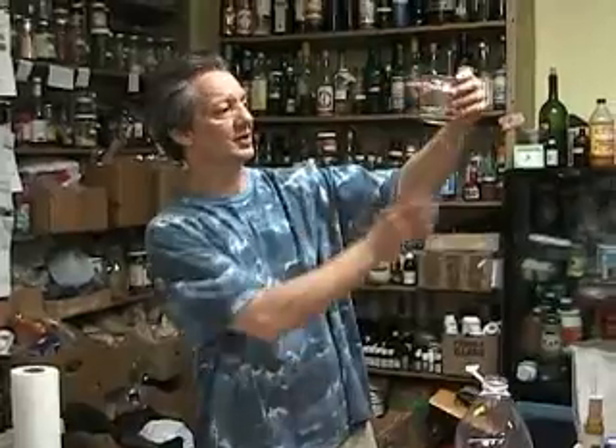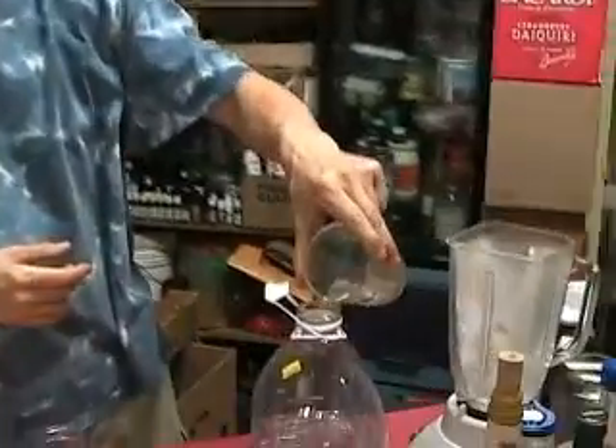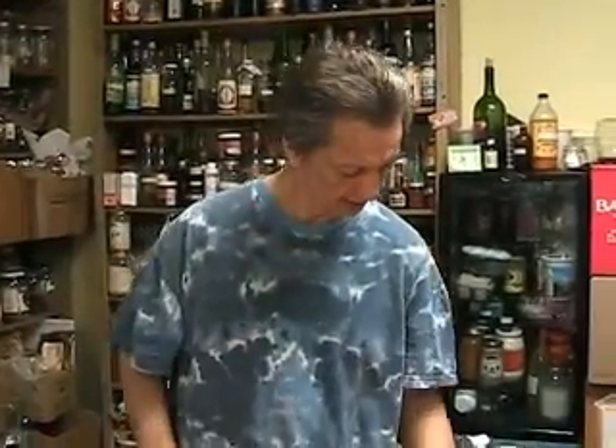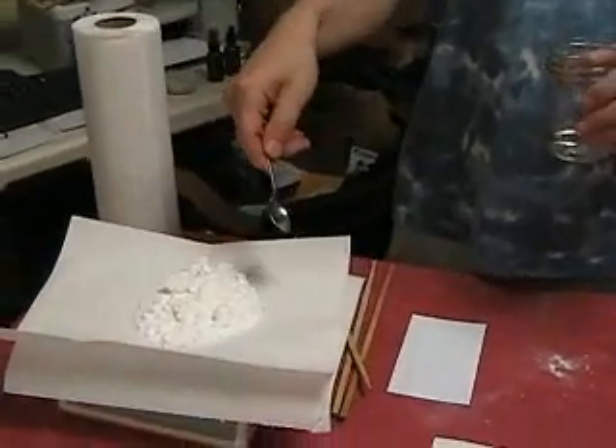Just so that everybody knows this. So we're going to measure this off — one ounce, give or take. It doesn't have to be an exact amount. All we want to do is maintain health. We want to get as close as possible, but don't get caught up splitting hairs. So we've got one ounce in. We've weighed this out at six ounces — I put six ounces here so I don't have to keep weighing it. We're probably not going to use all of it anyway. I'm scooping it in.